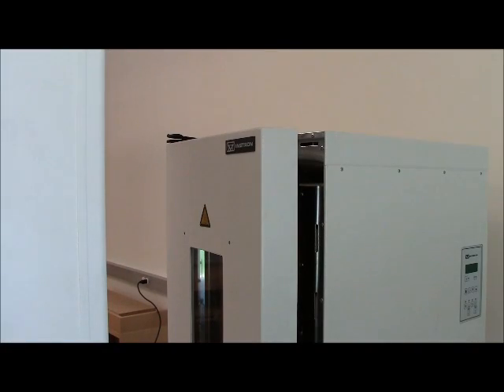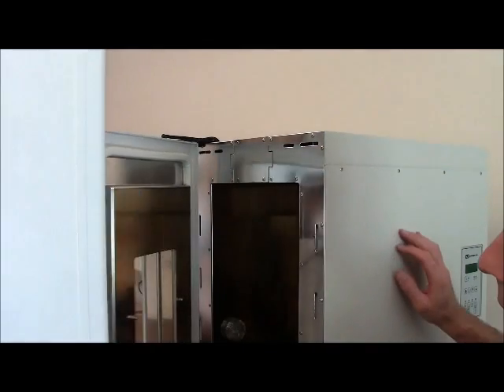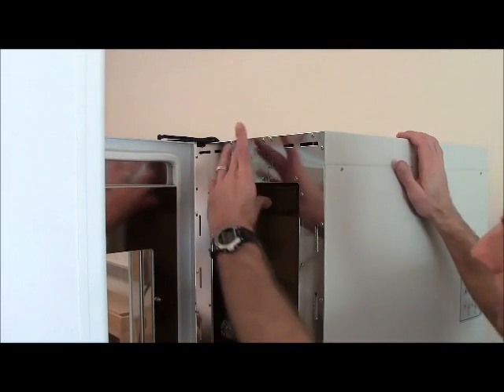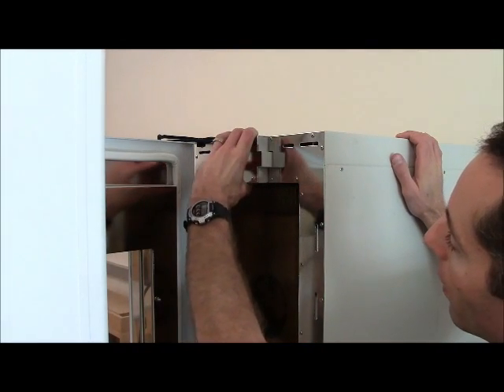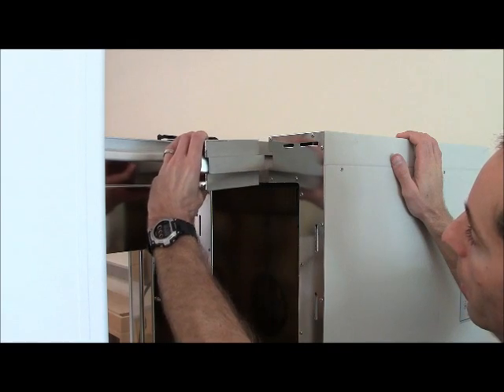We're looking at the top of the oven and I want to show you how to remove the insulating wedges that allow you to slide the oven forward while the pull rods are in place. I'll open up the door and I'll note that at the top we can pull the wedge out carefully.